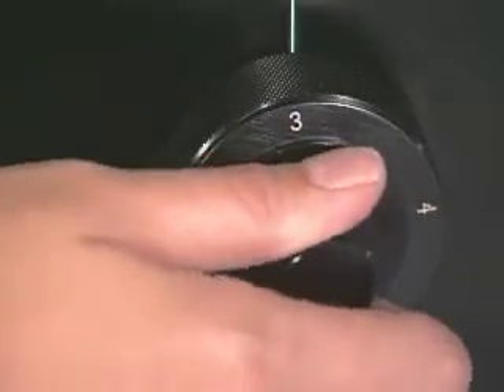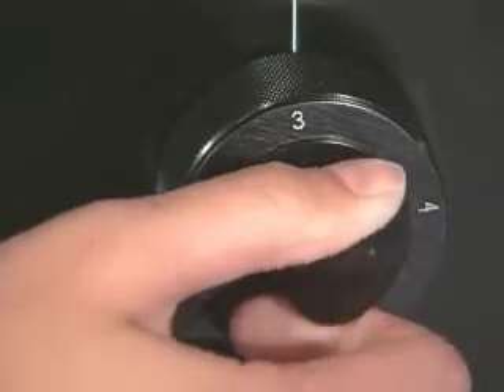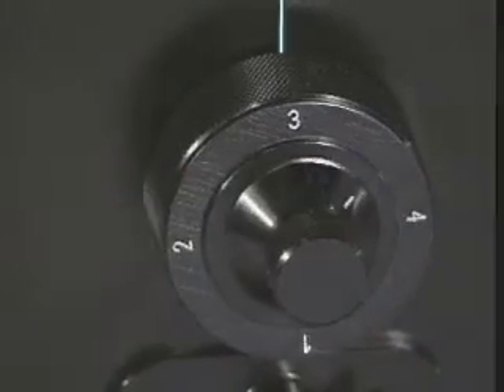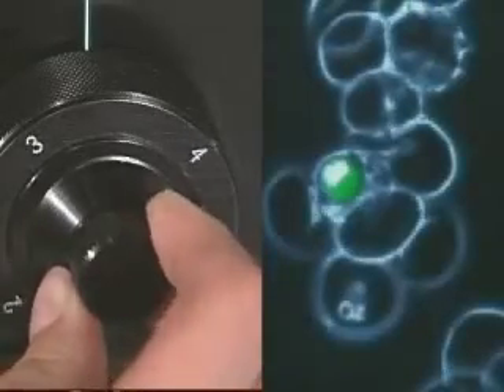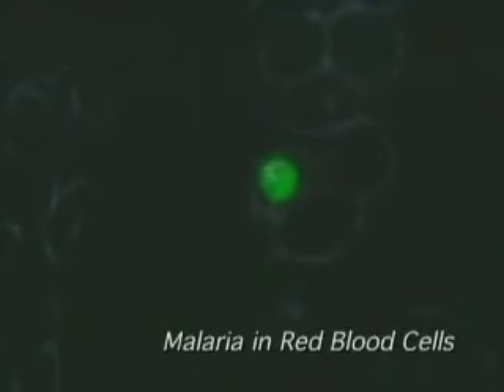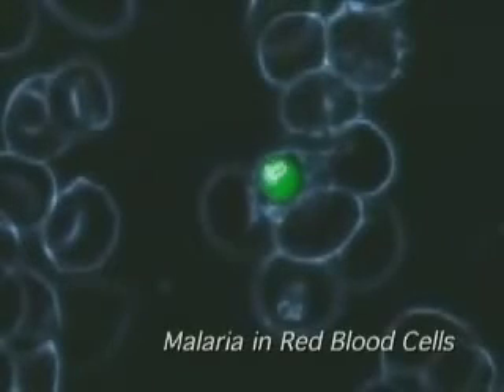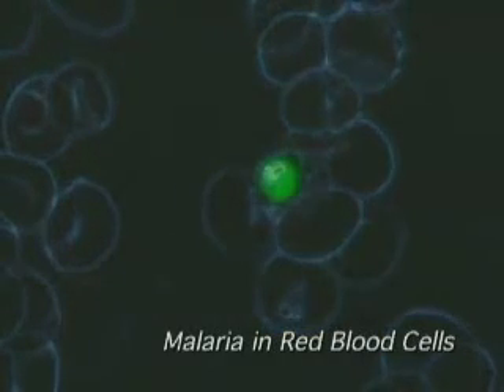The fine adjustment knob is used for precisely modulating between full unfiltered modes and full fluorescence. Observe the effect as the fine adjustment knob is turned. The key feature of this system is that the user can easily transition between any combination of these modes — by simply turning a single knob, you can transition between and superimpose fluorescence and unlabeled structures without complicated microscope adjustments, software, or electronics.